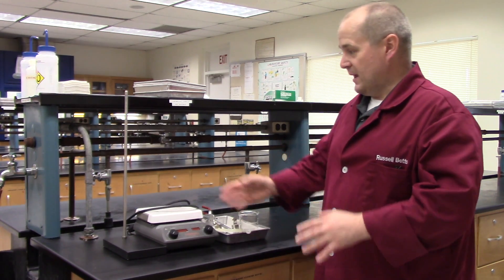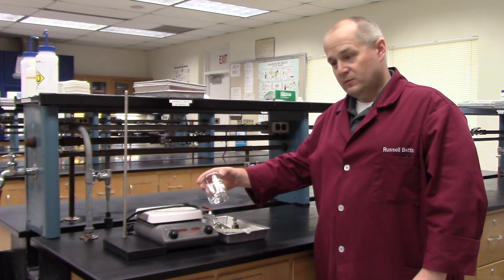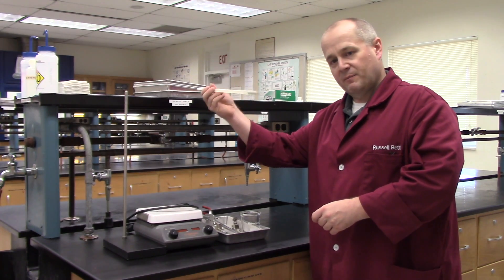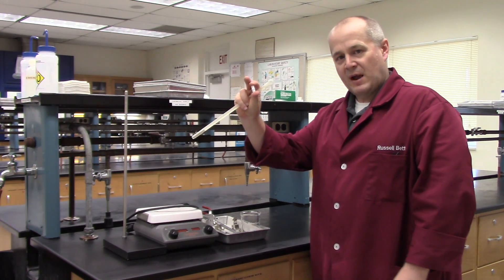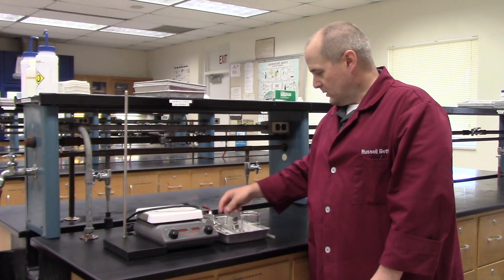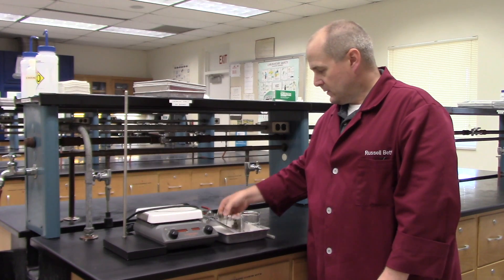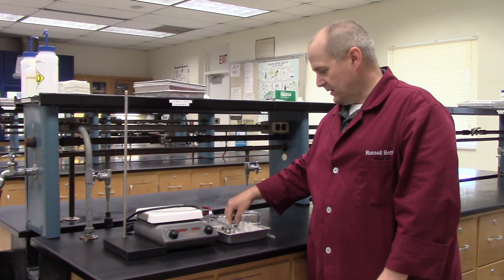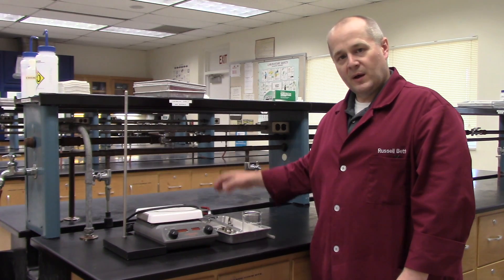To start with you need a clamp stand. You're going to need a hot plate — these are found in your bench in one of your top drawers. You need a 250 milliliter beaker. You need a stirring bar remover, which is just a magnet inside of a piece of plastic. You need a stirring bar, which is just a small magnet wrapped in Teflon. You will need a thermometer clamp — these are found in your bench in the very bottom drawer. You need a three prong clamp and a clamp holder, which are found in your bench when you come to lab.